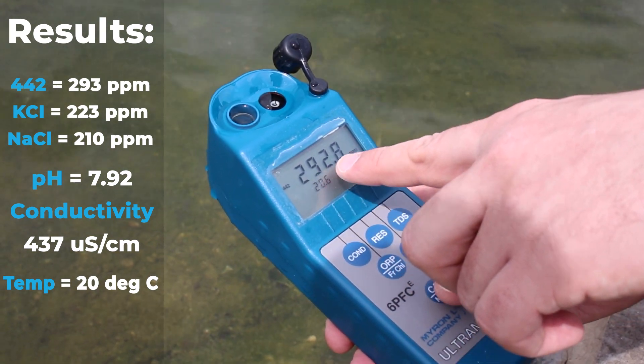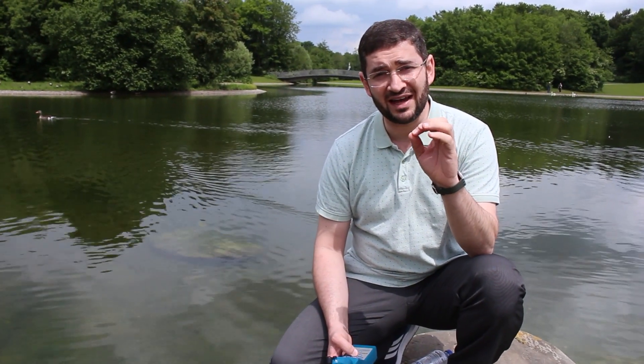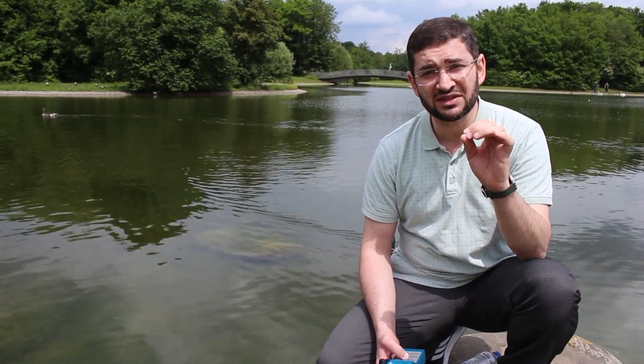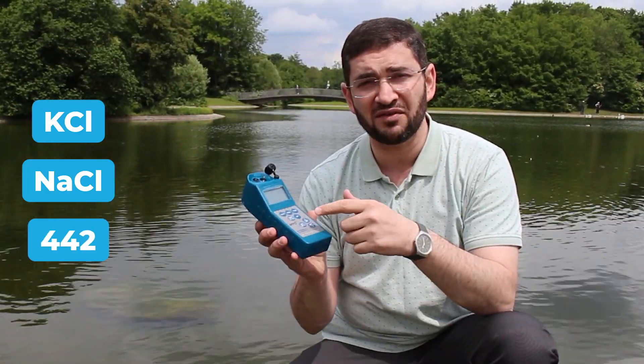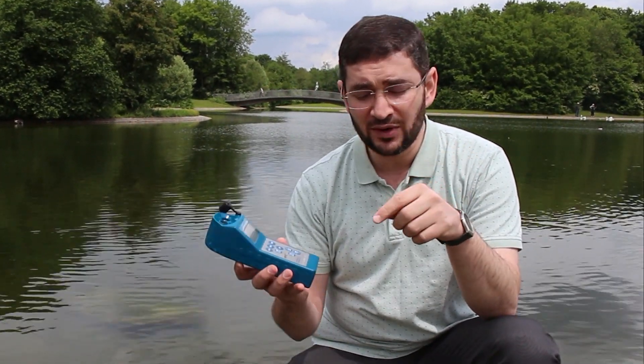Let's keep in mind one important fact: when measuring TDS and conductivity, it is very important to select which measurement option you are using — KCL, NaCl, or 442. The 442 option is mainly found in Myron multimeters.